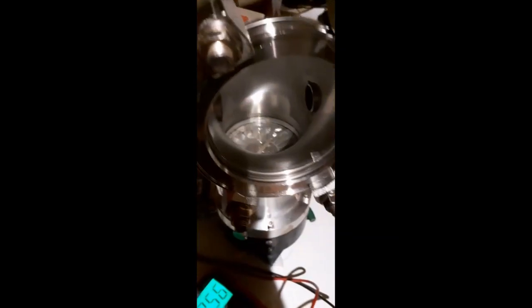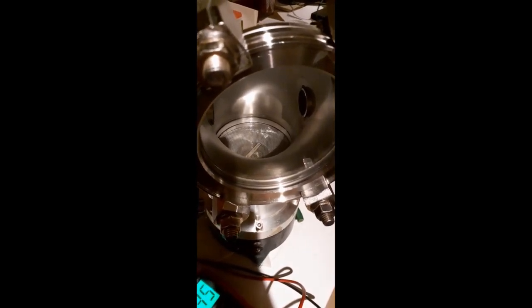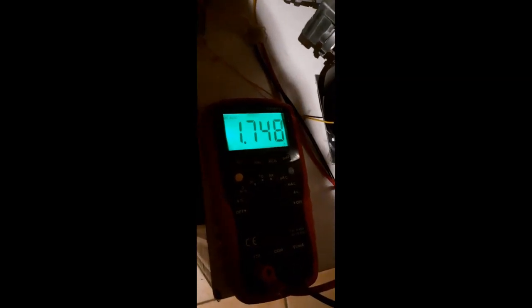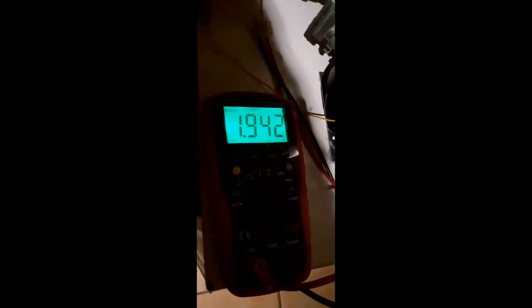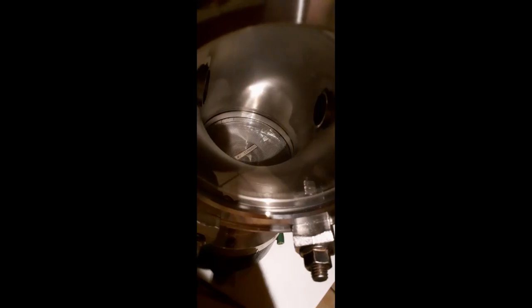And now we can turn on the turbo. Turn on. Turbo spins up. And as you can see, it's drawing a lot of power. It can draw something like 2.2 amps, and it definitely will. What looks like the blades is actually the static blades on the layer below. You can hear it winding up now, and it's drawing about 2 amps.